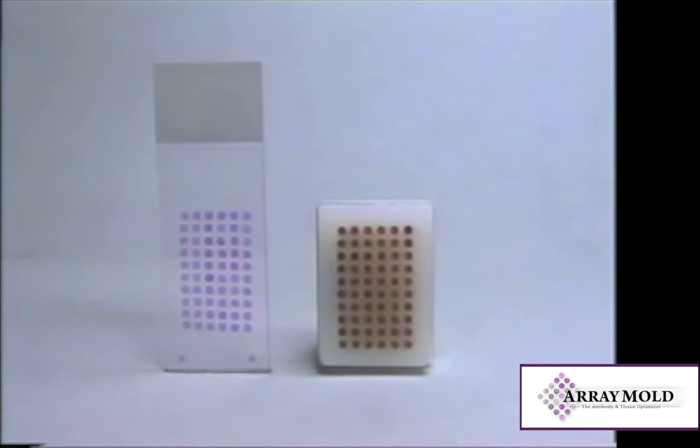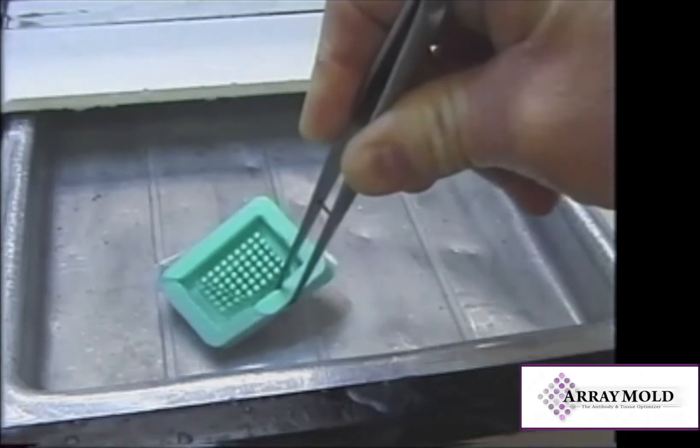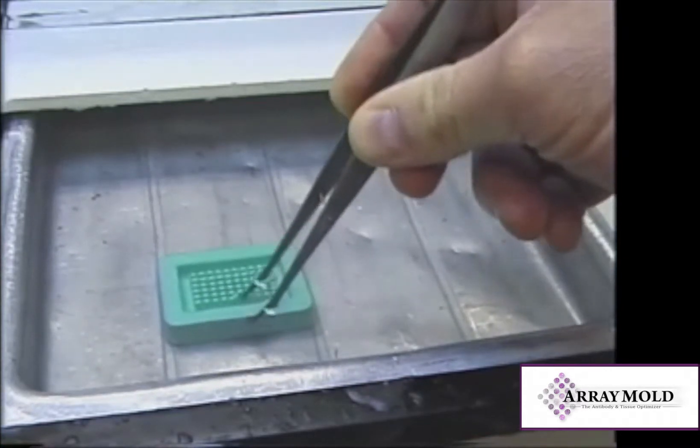Paraffin array construction is very simple as well. Using the same mold, submerge it into a paraffin bath. Allow the mold to heat up for approximately 15 minutes.